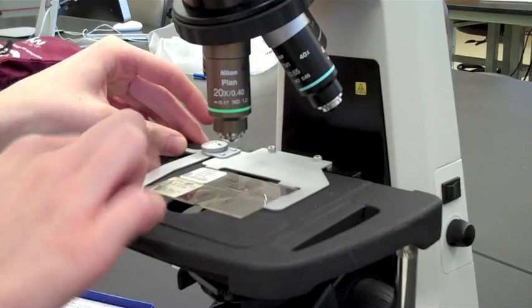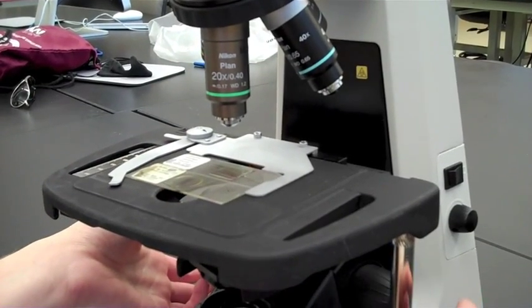You can also put two slides on the stage for easier viewing. This is useful for comparing two slides.